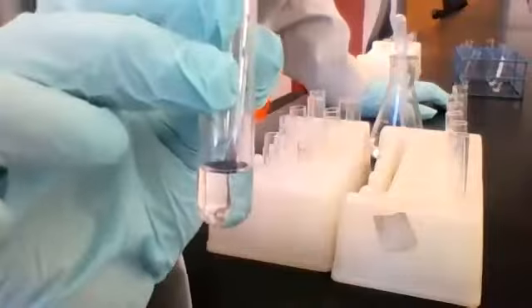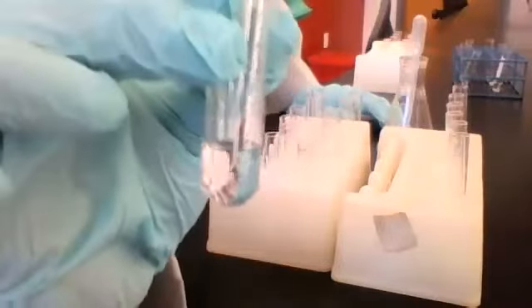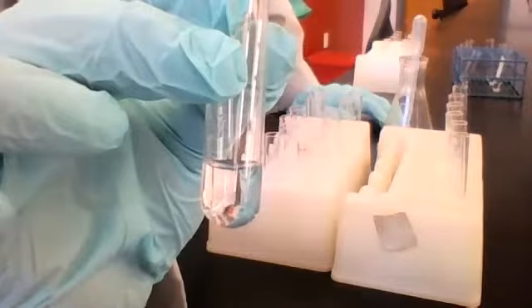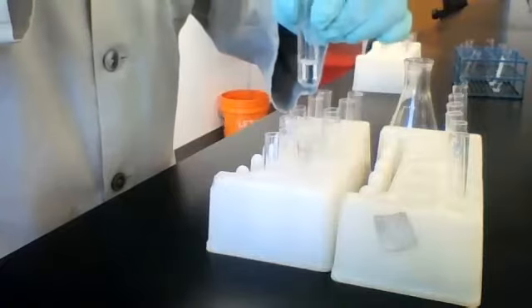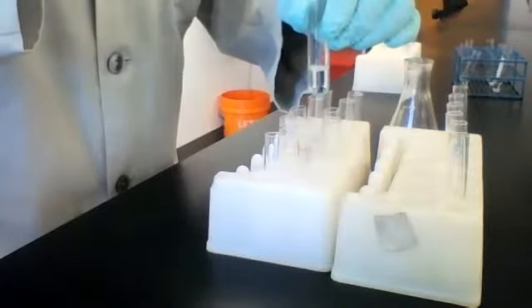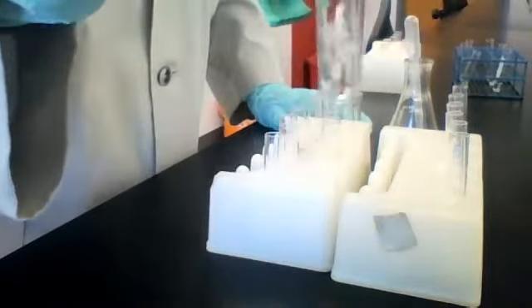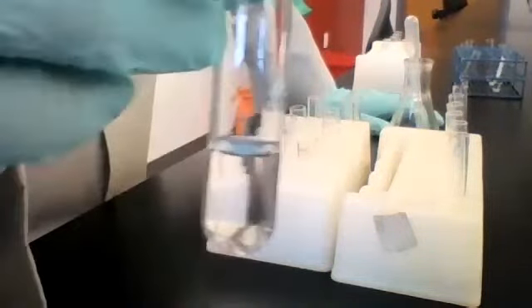So what do y'all expect to happen when I add sodium hydroxide to water? Do you think you're going to see a precipitate? No, no. It should look exactly the same unless there's something contaminating the water, right? So let's go ahead and prove that prediction. Shaking to make sure everything's thoroughly mixed.